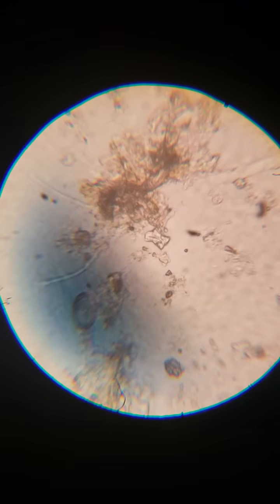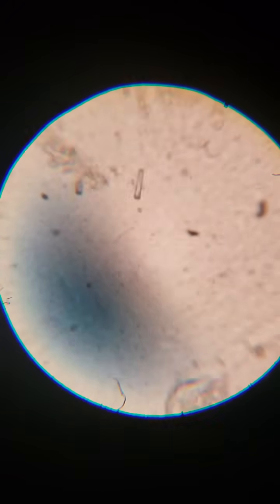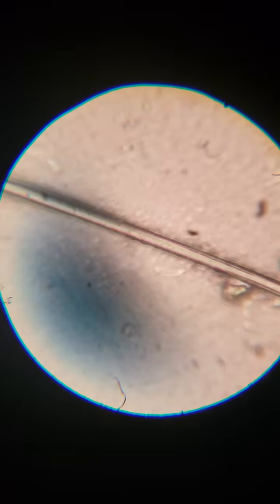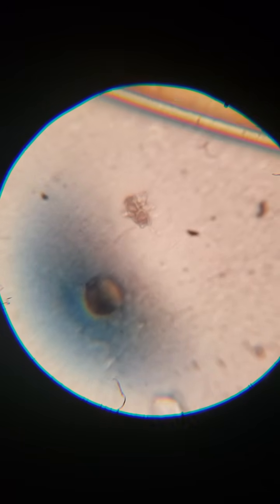You can see a little organism. Where'd it go? You can see, this is algae that has died, those little perfectly square things, or they're plant cell walls that are broken off. There we go. That was a single, here's a little single cell organism there.